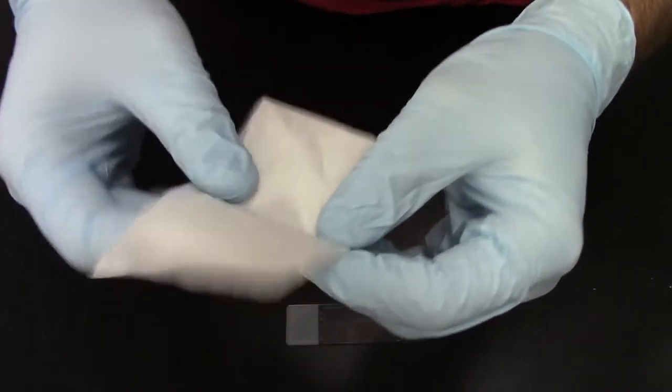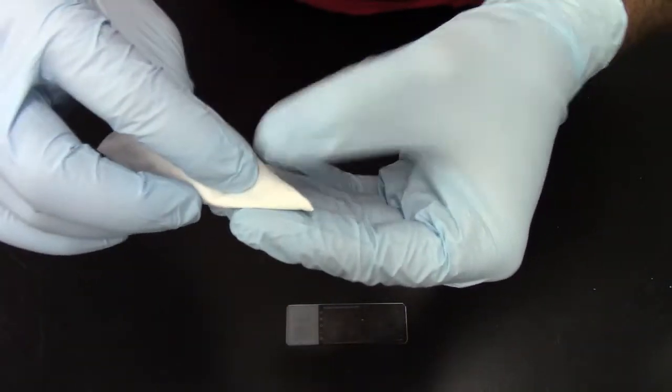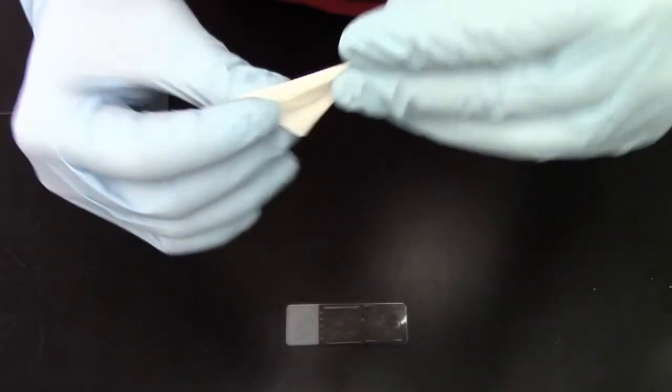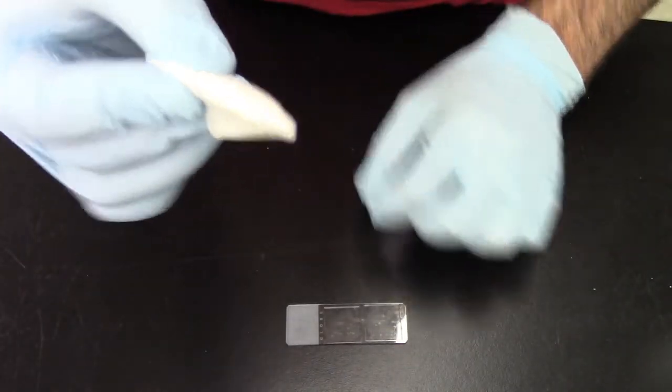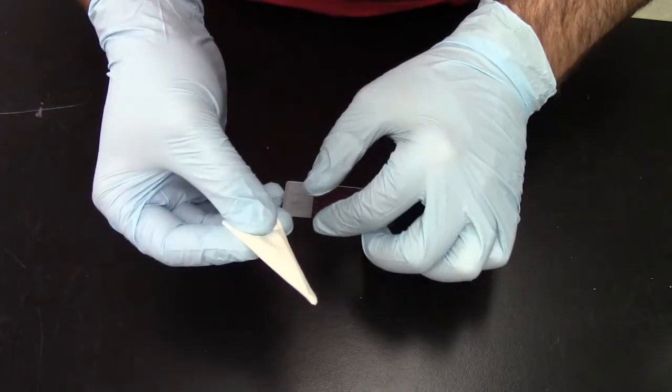So I keep folding it, keep folding it, keep folding it into something that looks like this. This is not very scientific but this works extremely well.